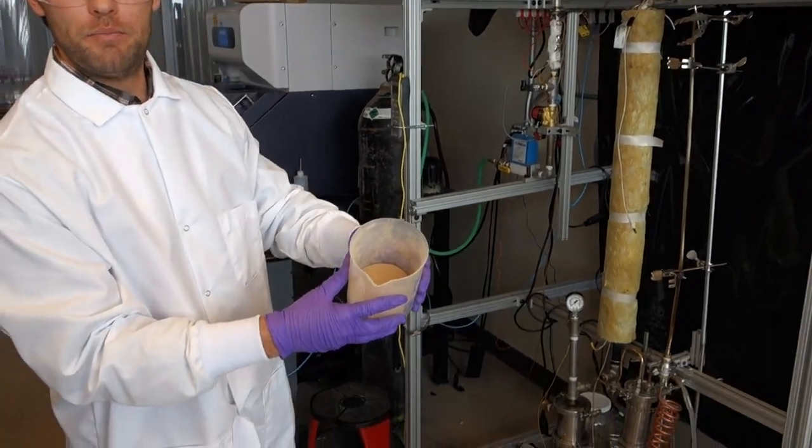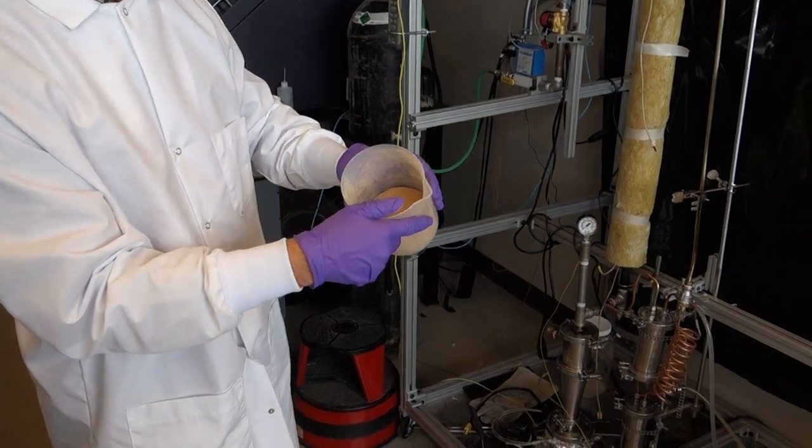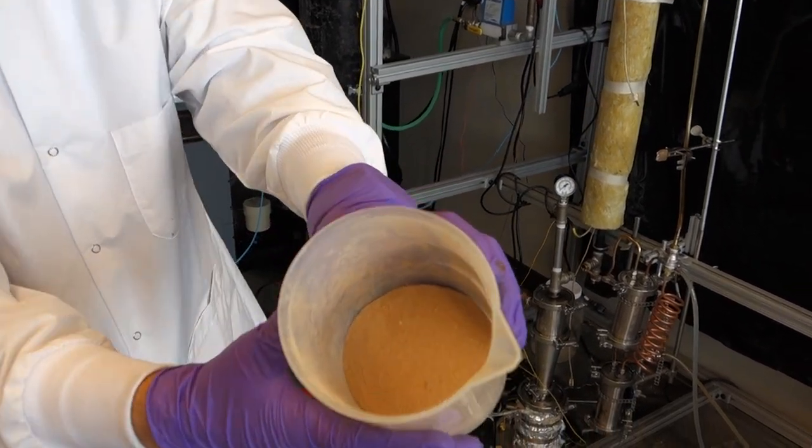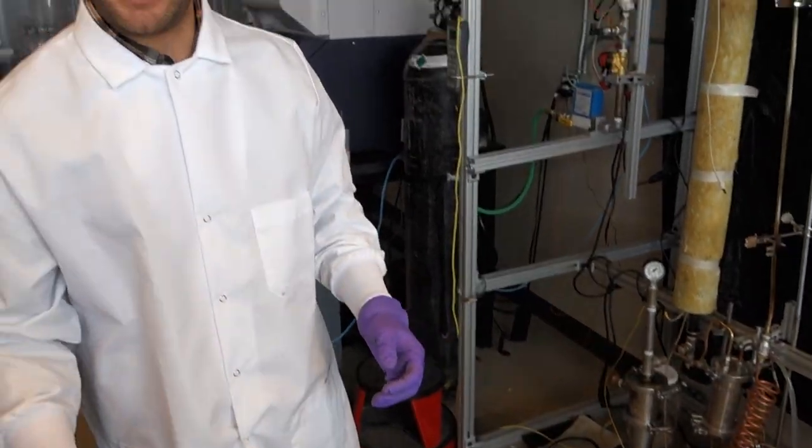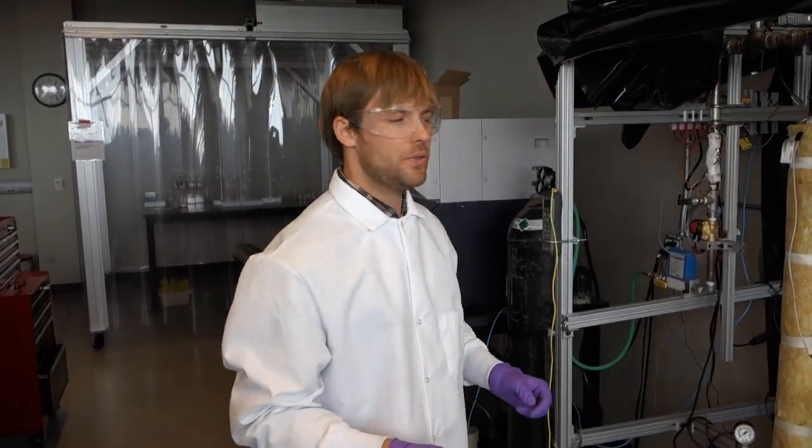This is biomass, looks very similar to sawdust. You can see close there. This has been finely sifted so that we can control heat transfer based on the particle size.